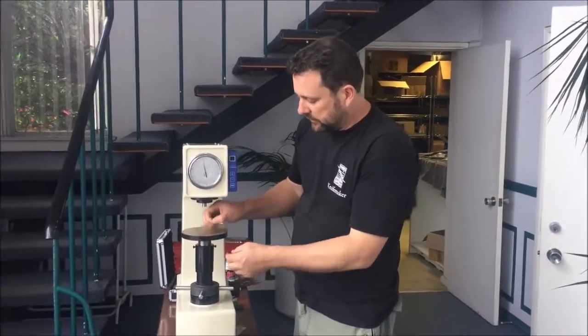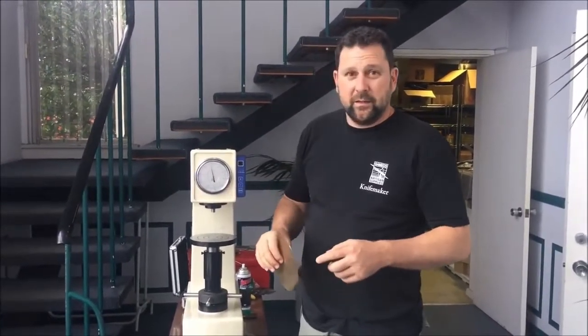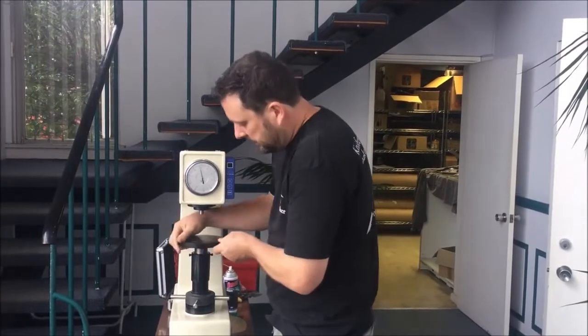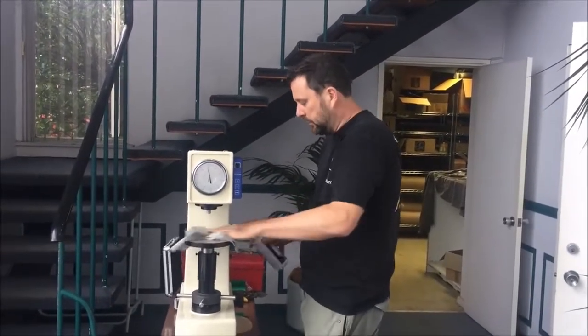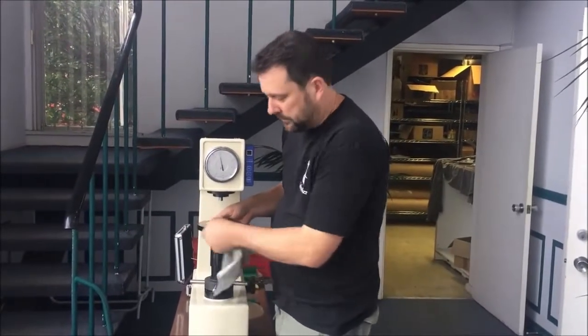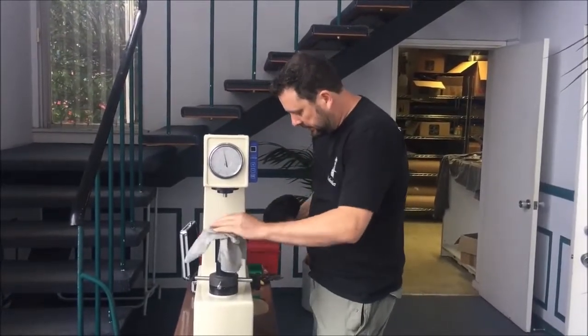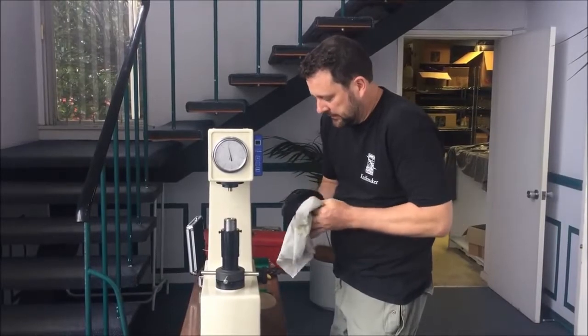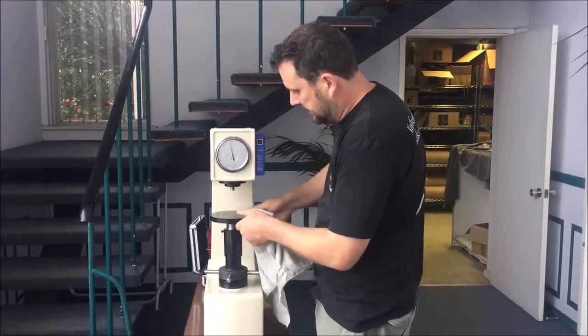What you'll notice is all the parts are covered in grease, which is lovely. But if I put a blade or a piece of steel on this grease and I push down with the indenter, what's going to happen? It's going to displace grease, move down further, and the hardness tester is going to think that the part's much softer than what it is. So you need to make sure that before you start, you clean all the grease off, particularly off the anvils. You might like to go into the screw thread as well, it will make a difference. You need to keep your machine oiled to protect it, but all of this oil is going to affect your readings for sure as it extrudes out and displaces.